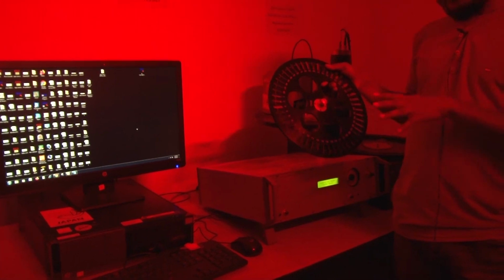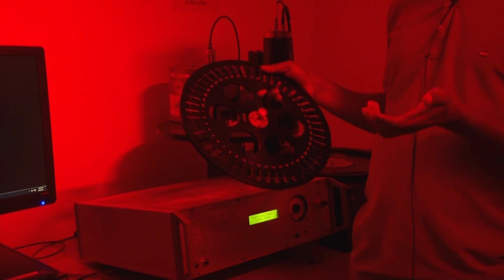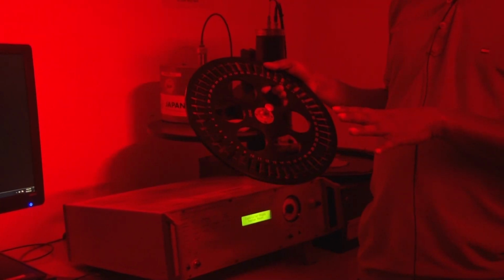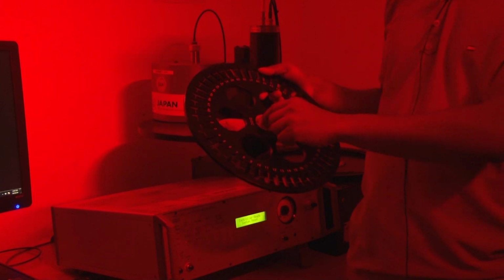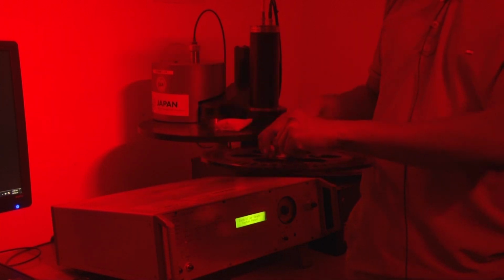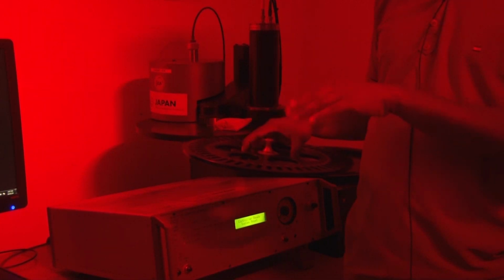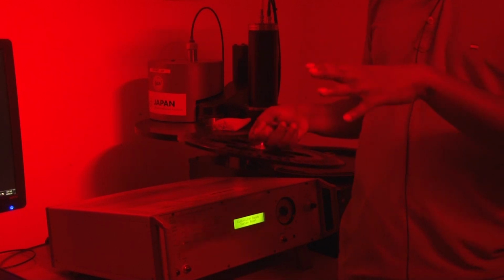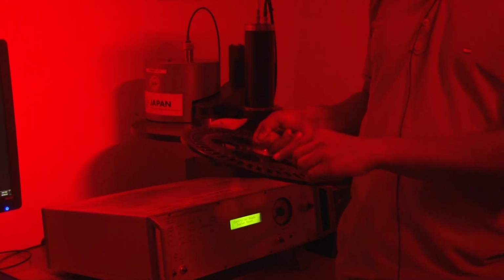We can prepare a minimum of 10 to a maximum of 100 aliquots. That aliquot basically represents your sample, and we measure the equivalent dose for each and every individual aliquot. The sample we have prepared, we put on the disc with the help of some adhesive, and that aliquot we put over here.